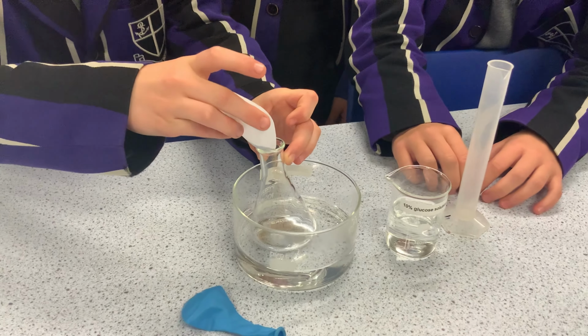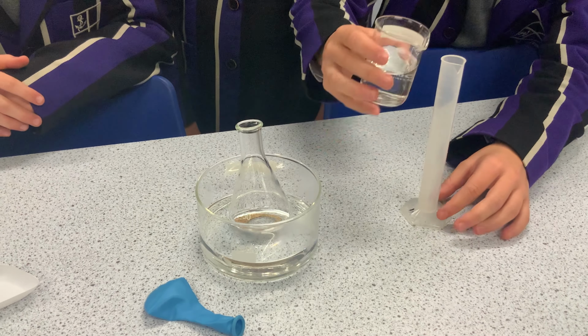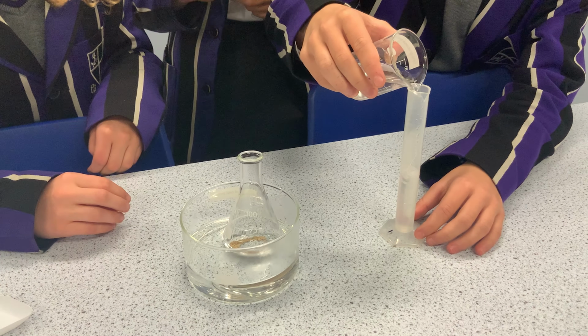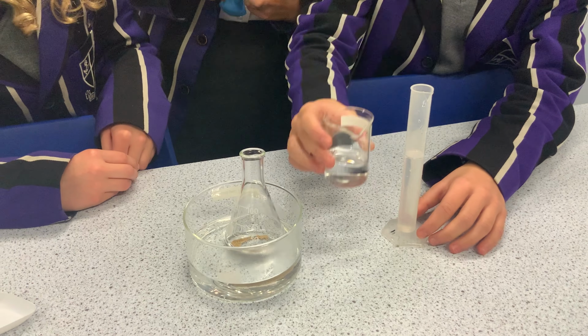The last activity we want to share is the yeast-air balloon experiment. We usually use this activity as a whole class experiment while teaching anaerobic respiration in yeast, also known as fermentation. These are the materials we need. First, students are asked to add yeast and sugar to a conical flask containing warm water. Warm water is used here to speed up the fermentation reaction, so students can see its effect on the balloon towards the end of the lesson.